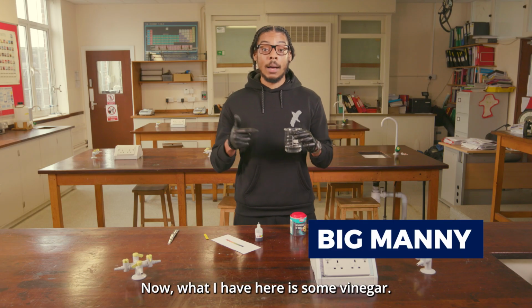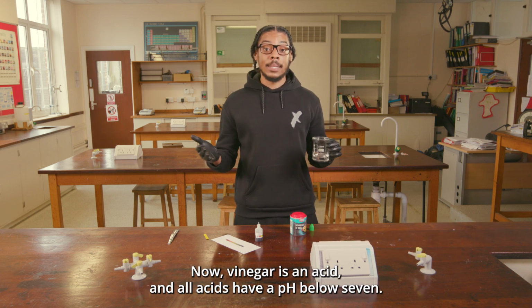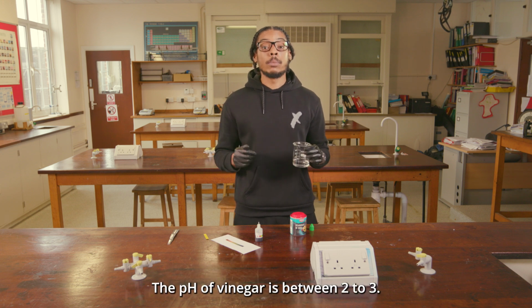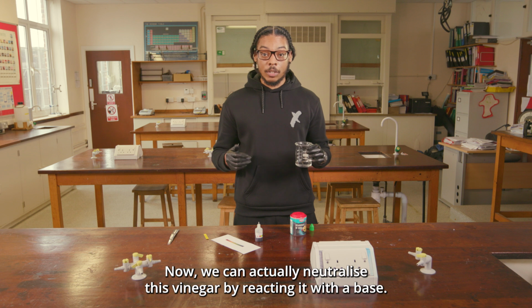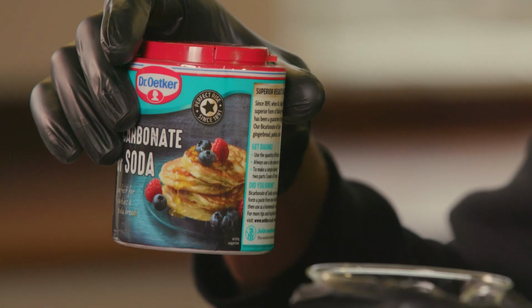Alright, cool. Now what I have here is some vinegar. Now vinegar is an acid, and all acids have a pH below 7. The pH of vinegar is between 2 to 3. Now we can actually neutralize this vinegar by reacting it with a base, and the base that we're going to use is sodium bicarbonate.